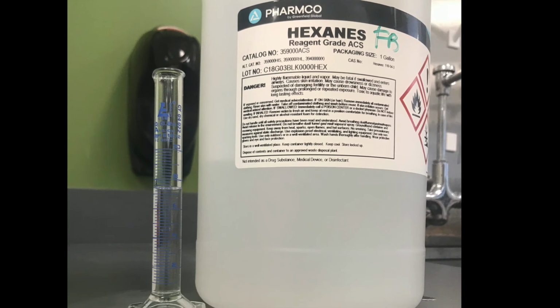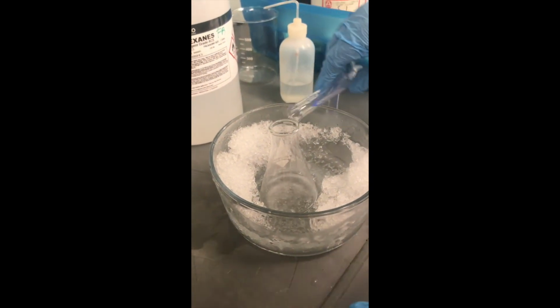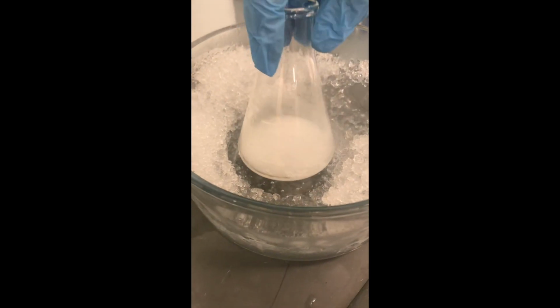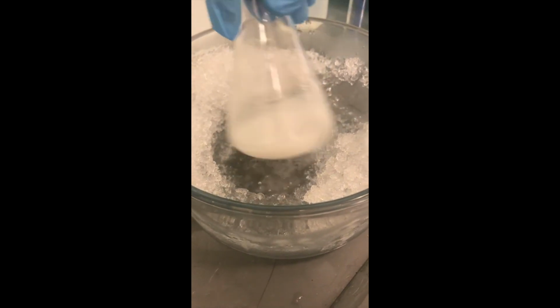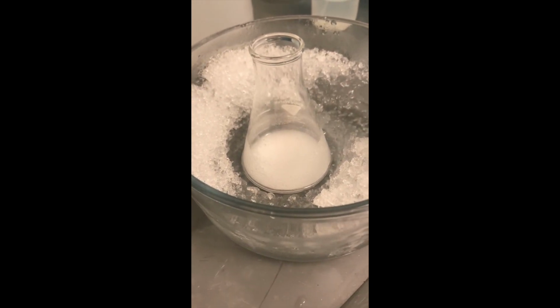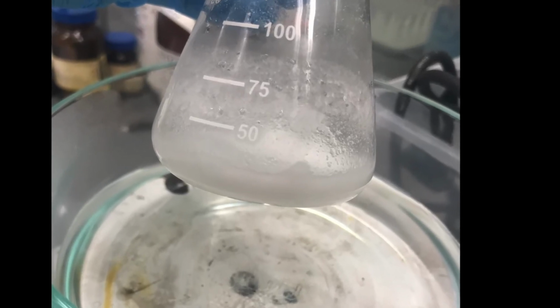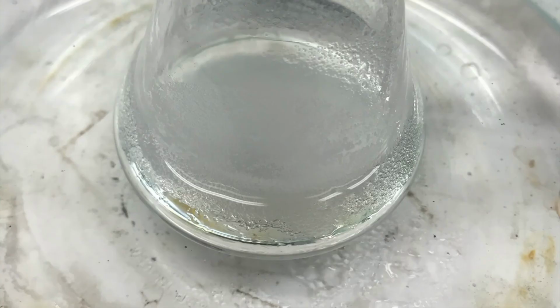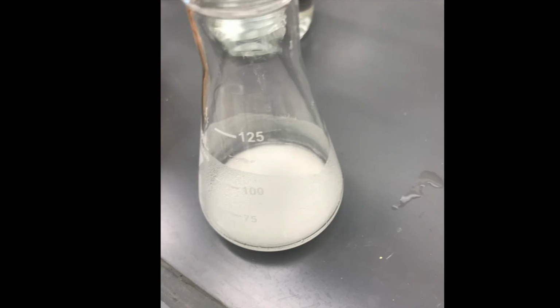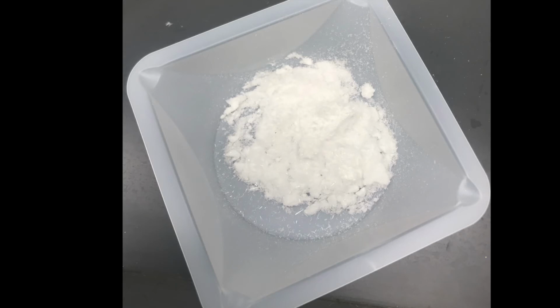Now measure out 7.5 milliliters of hexane. Add that to the cooled flask with your reaction, replacing it in the ice bath, and watch as your product crystallizes from solution. Once the product crystallizes, heat the mixture in a hot water bath to redissolve the solid and allow it to recool to induce crystallization in that same container. Once your crystals form, collect the product by vacuum filtration. Take the final weight of your product, calculate the percent yield.